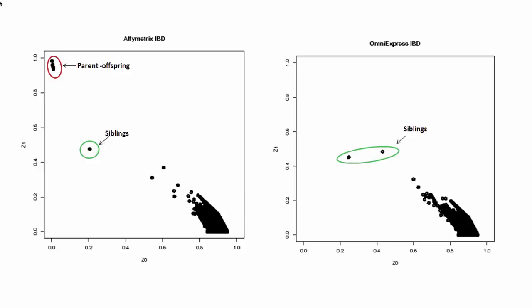One useful summary of the IBD information is to plot Z1 versus Z0. This allows us to visually identify sample duplicates as well as particular relative pairs. So when we compare these IBD estimates with their self-reported relationship information, we confirmed the first degree relationships. In the Affy data, 5 parent-offspring pairs were identified and 1 sibling pair, and there were 2 sibling pairs in the OmniExpress data. These genetically inferred relationships are concordant with what we knew from the PED file.